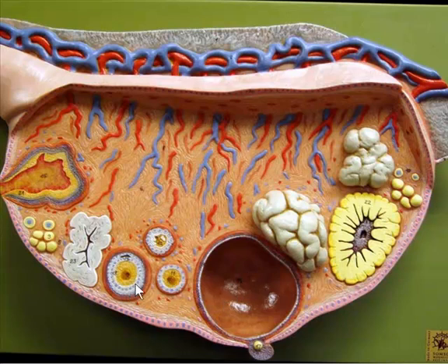It's kind of debatable as to when you get a secondary follicle. If you have multiple layers of follicular cells and then just the beginning of an antrum, then they graduate and say that that is a secondary follicle. But in the slides we would really focus on the presence of the antrum to identify a secondary follicle. Now, when you have multiple secondary follicles, as you commonly do, it's the largest secondary follicle that also gets the name of mature follicle, also known as Graafian follicle.